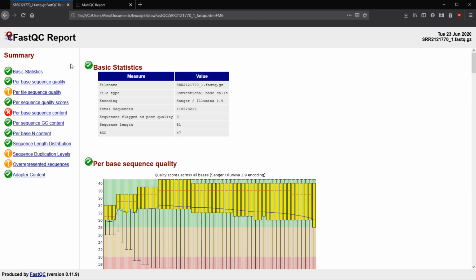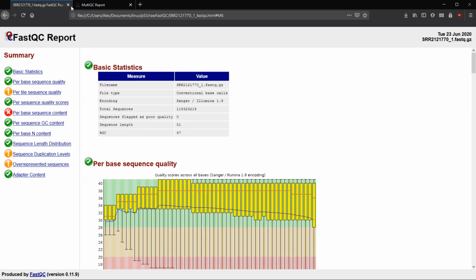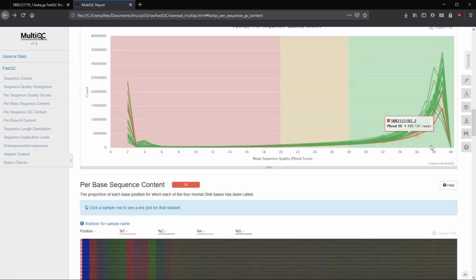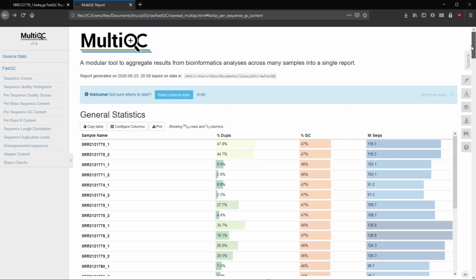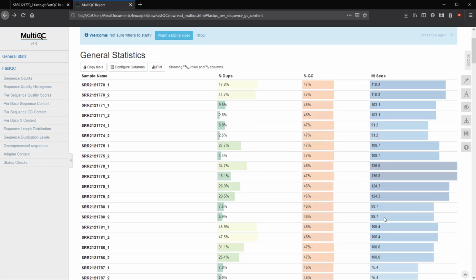But here we have both the SRR 2121-770 forward read that we had looked at a little bit last time before we went on to trimming. And then we also have the MultiQC report. And the MultiQC report has everything, all of our reads thrown together. So we have our SRR 2121-770 forward, 770 reverse, 771 forward, reverse, so on and so forth. All the way down. We can click this to show everything.